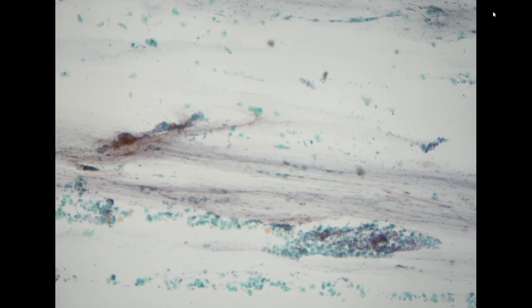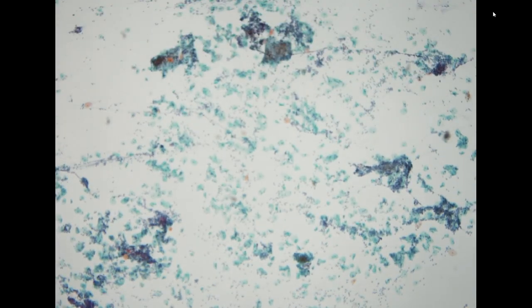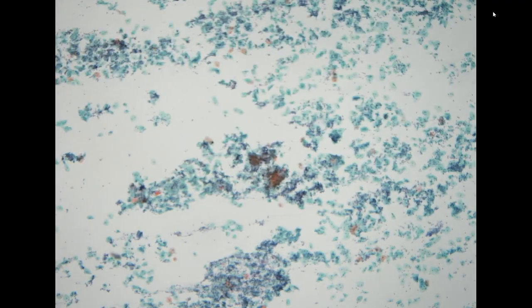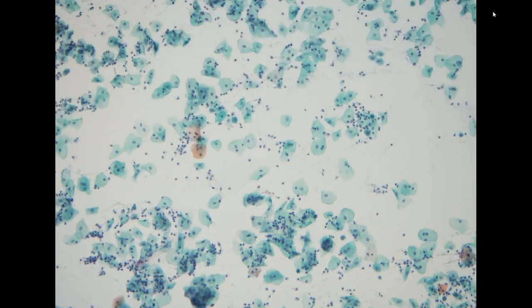Finally, this is a pap smear from a 57-year-old female. So supposedly she already had menopause. We see most of the cells look like intermediate cells with very scant superficial cells, compatible with the age. And the background is pretty clean. So in this situation, we will usually look for either microorganisms or a precursor lesion.